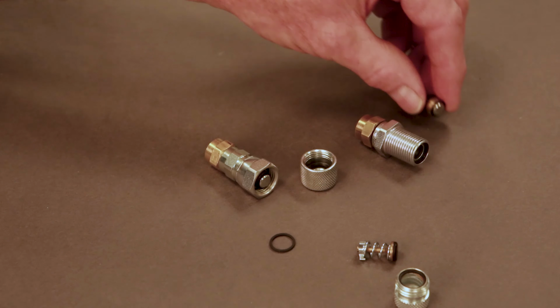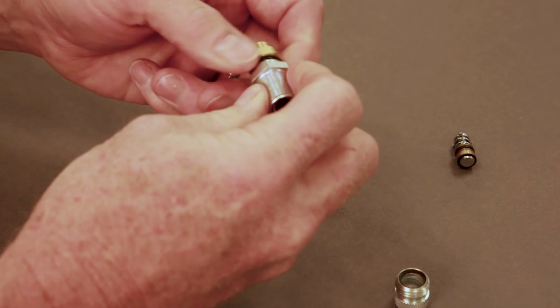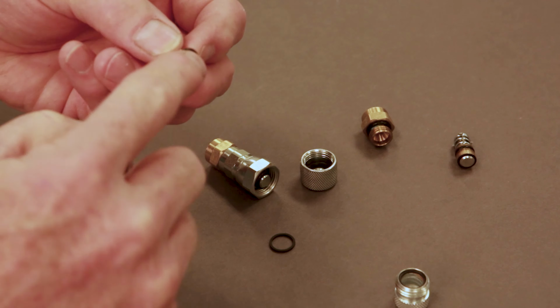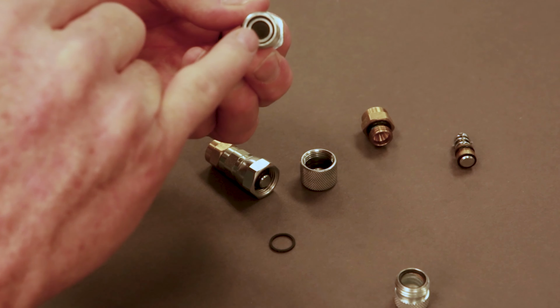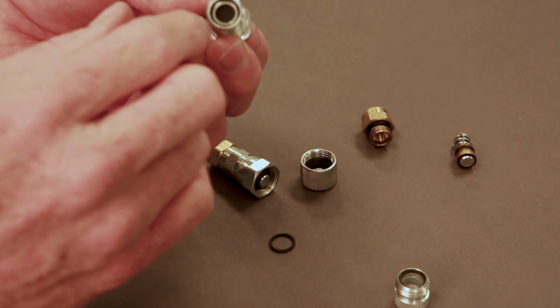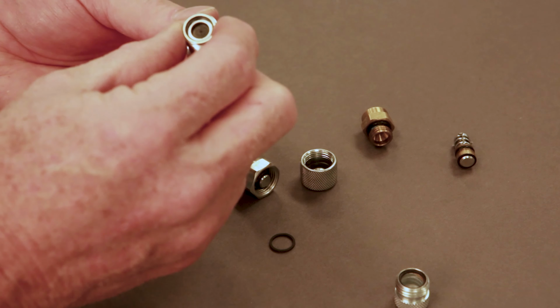Now these are the two valve assemblies that are inside the male and female ends of the fittings. These will also sometimes fail. On this end, the refrigerant will sometimes get underneath and form a bubble on the surface. And you'll see a mound right there that'll be soft. You can push on it and it'll go down. If that's the case, this fitting should be replaced. Eventually, it will split down the middle and leak refrigerant.